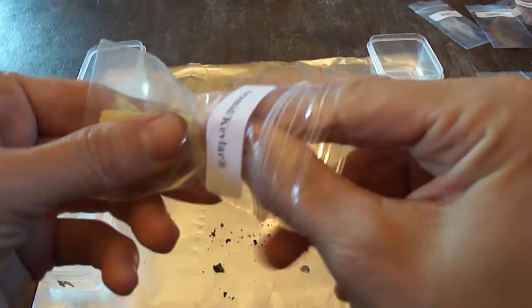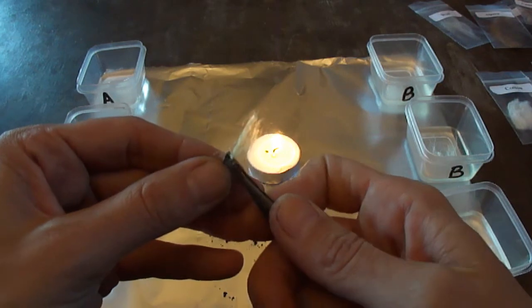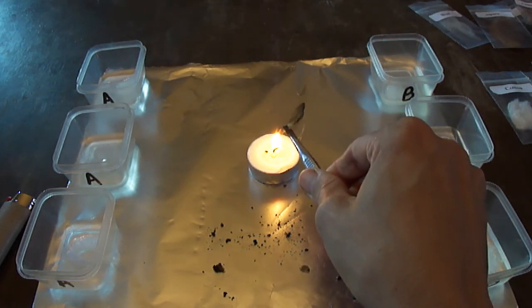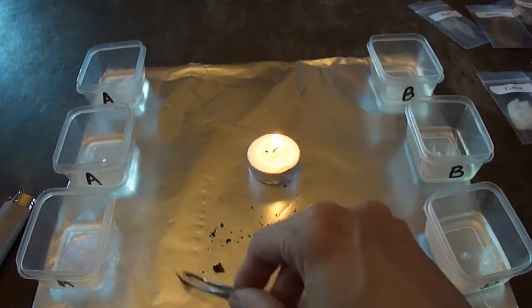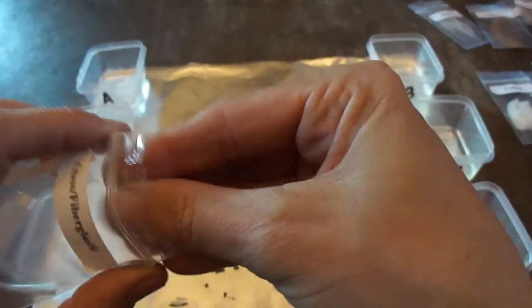For fun, let's try to burn some Kevlar — I can't remember exactly what's supposed to happen. It catches fast, definitely different. It gets a little ashy — this is not melting the way the other synthetics are. The Kevlar is more ashy, and the feel of it honestly reminds me of insulation. It does burn, so we can't pretend it's totally fireproof, but it's a slightly different response.